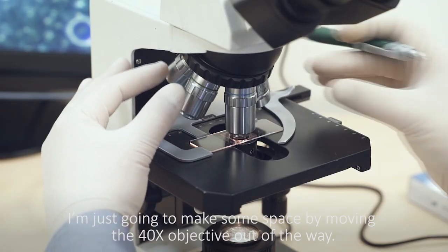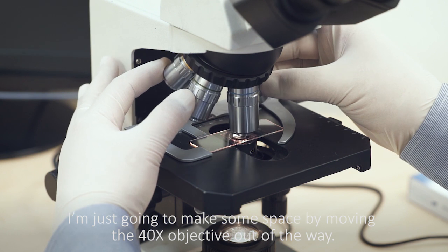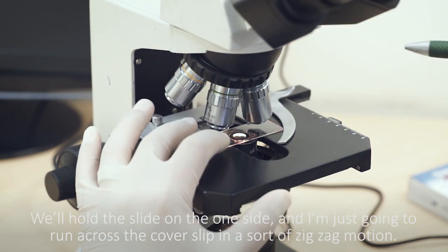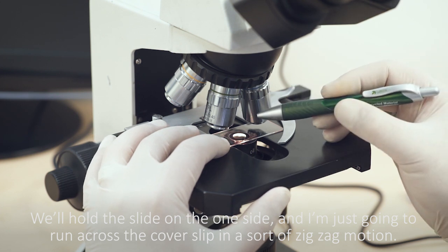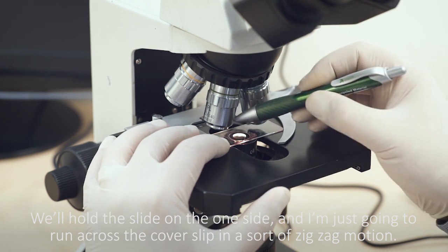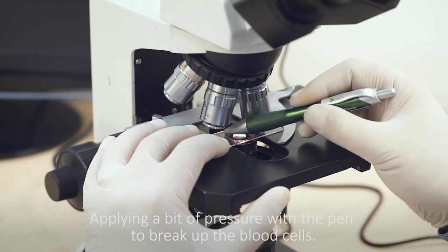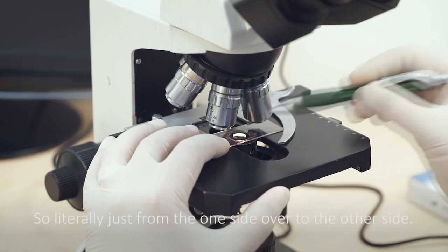We're just going to make some space by moving the 40x objective out of the way. We'll hold the slide on one side and run across the cover slip in a zigzag motion, applying a bit of pressure with a pen to break up the blood cells — literally just from one side over to the other.